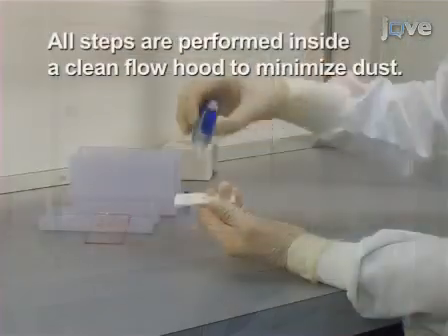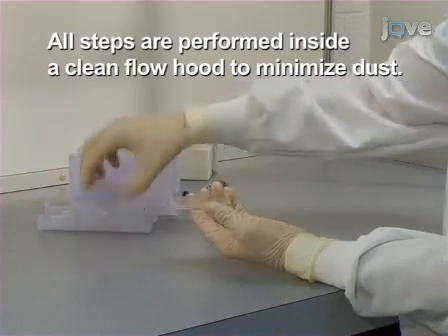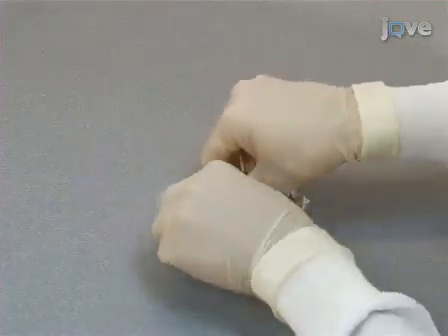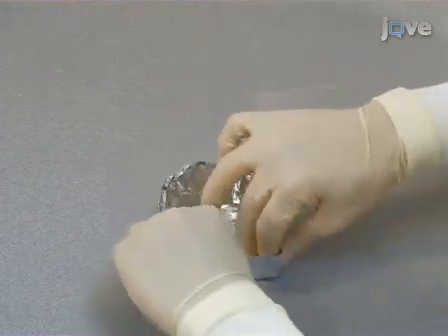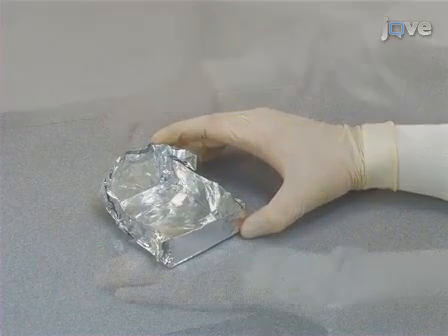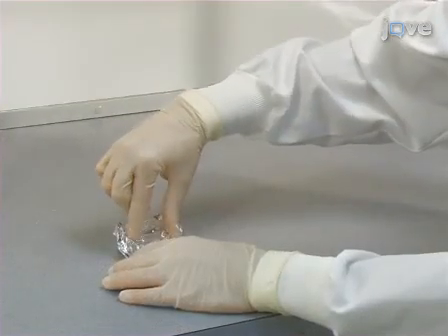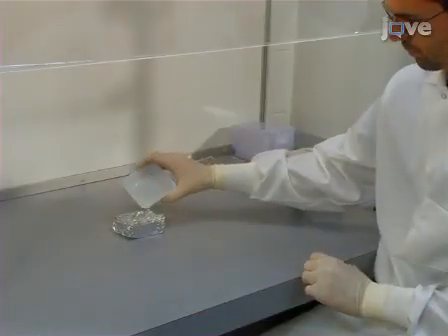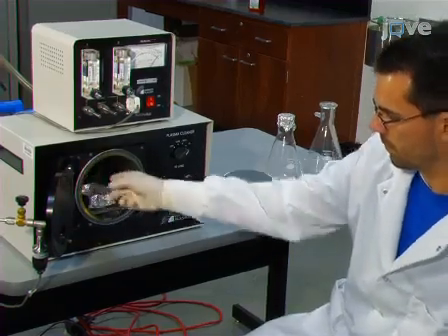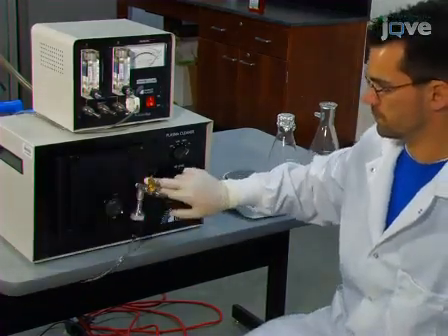First, use superglue to attach a pattern slide to a stack of blank slides. Next, create a container of aluminum foil slightly larger than the stack of slides and large enough to hold 30 grams of polydimethylsiloxane, or PDMS. Put the stack of slides in the container and then pour PDMS over the stack of slides to create an initial mold. Then degas PDMS by placing the container inside a vacuum chamber.